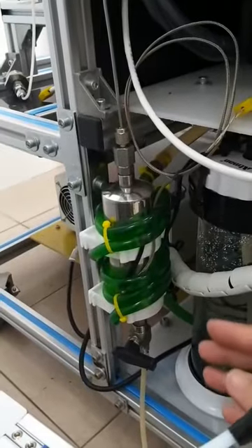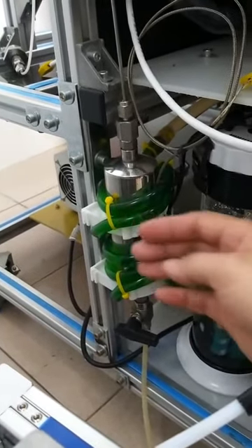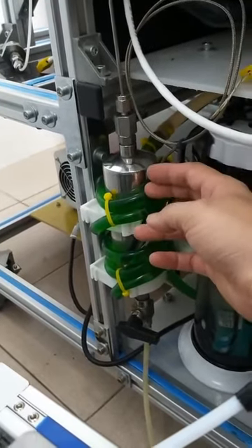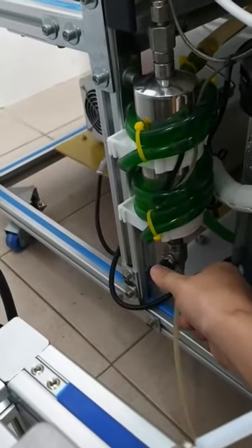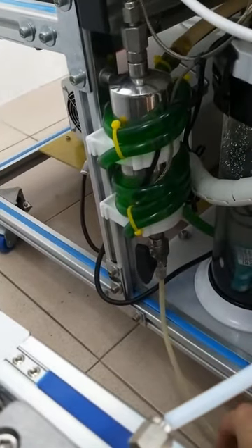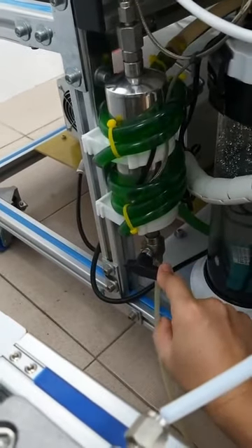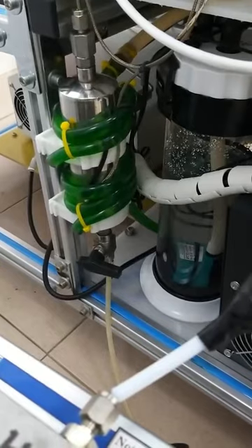A gas liquid separator was installed here. With the cooling of the coil tubes surrounding the gas liquid separator, the liquid will be condensed. After you finish the reaction, you can collect your liquid products from this tube. During your reaction, you must close this valve to prevent any leaking of your liquid products.